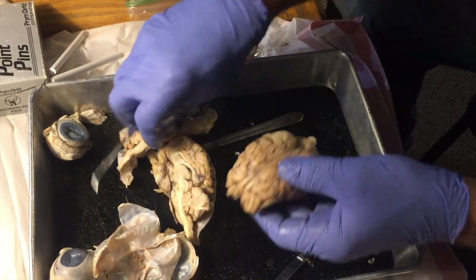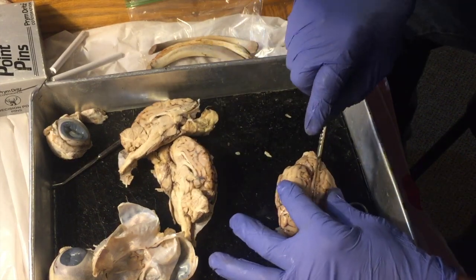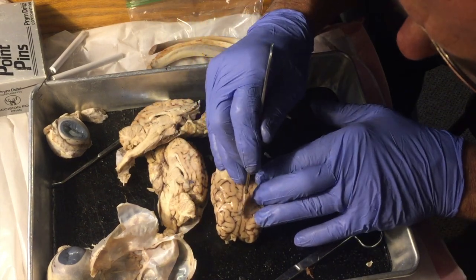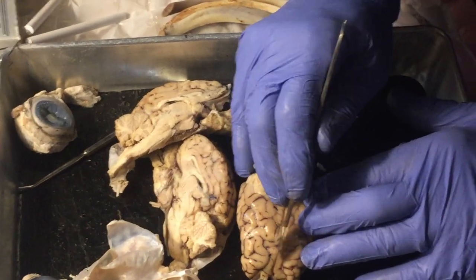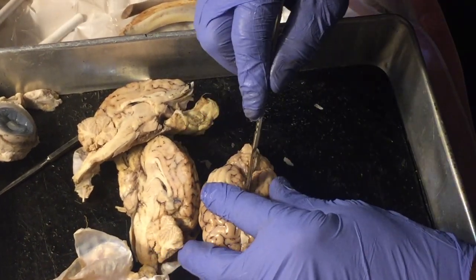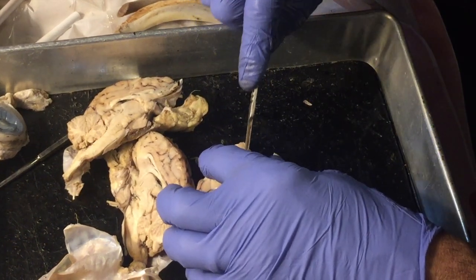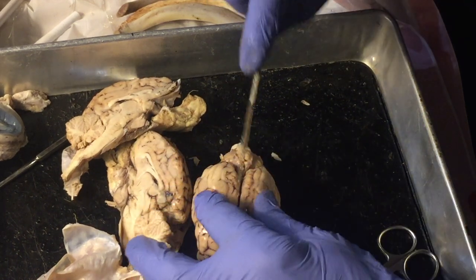I'm just going to slice this one in half again, real good, just to see how I do. I'll put it in the middle here, and sometimes some of these structures show up better because one cuts it just a hair differently one time compared to the next. So let's just give this a go here and see how we do.